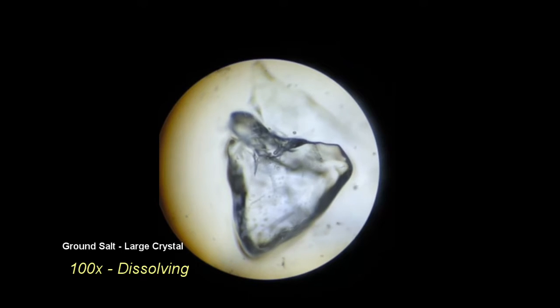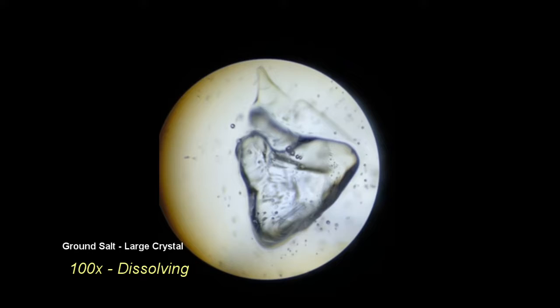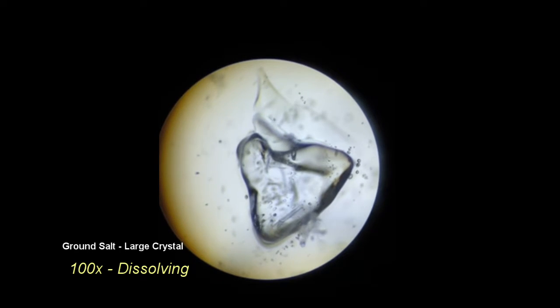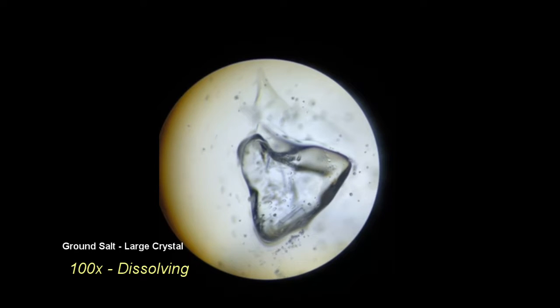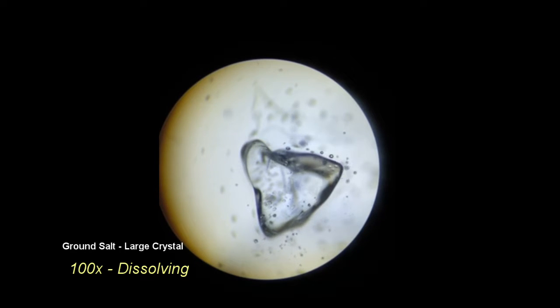I would hypothesize that the increased rate of dissolution may be caused by the inconsistent surface area. Due to the shearing effect caused by grinding, the surface of the salt crystal is very ragged and uneven. There appears to be no symmetry or pattern to the edges, leading to an increased total surface area for the distilled water to contact.